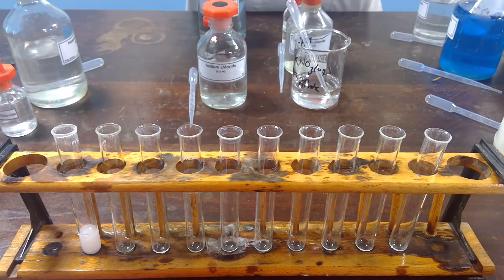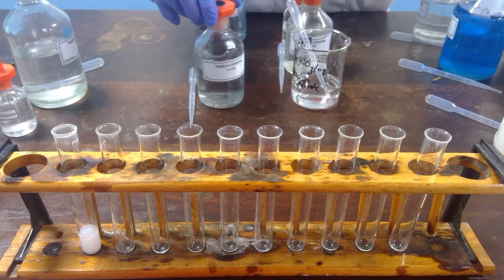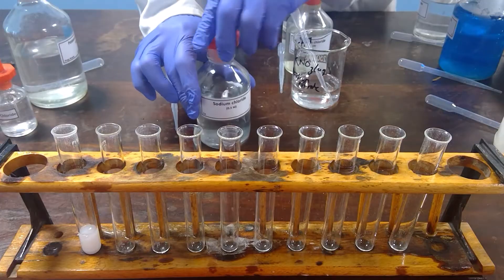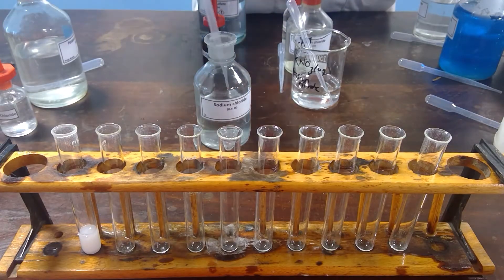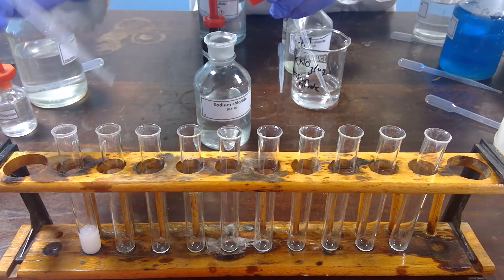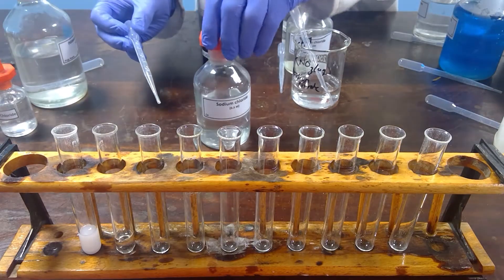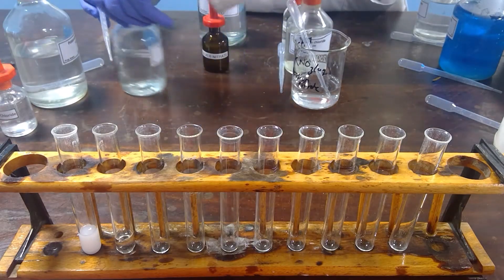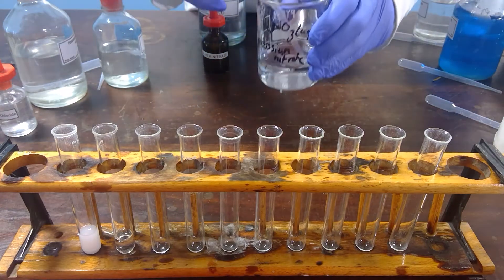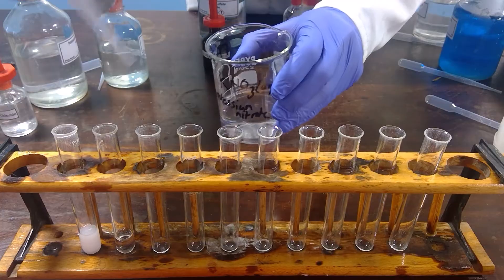Experiment 2: sodium chloride solution — a colourless solution — is combined with potassium nitrate solution, which is also colourless.